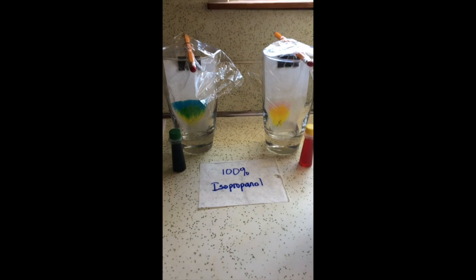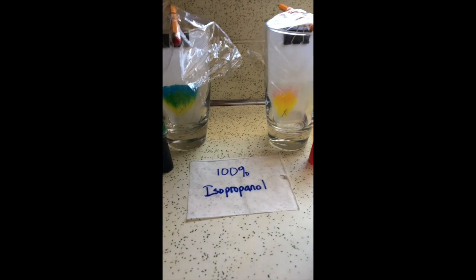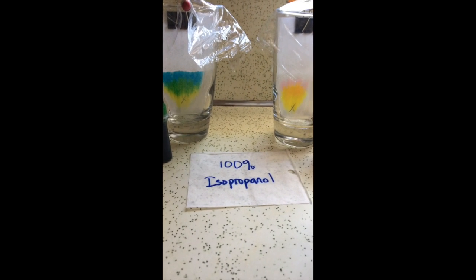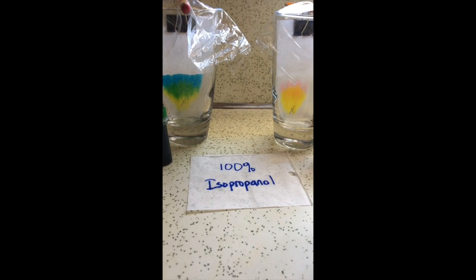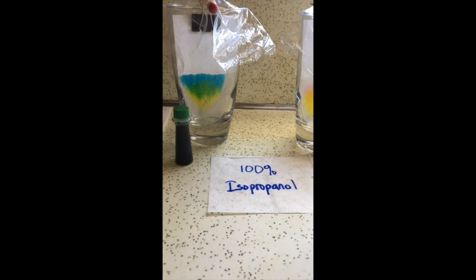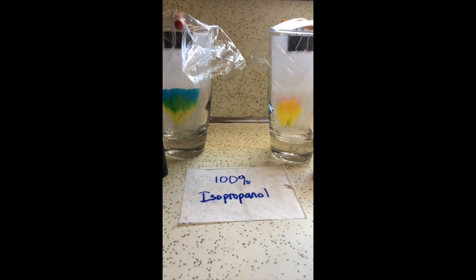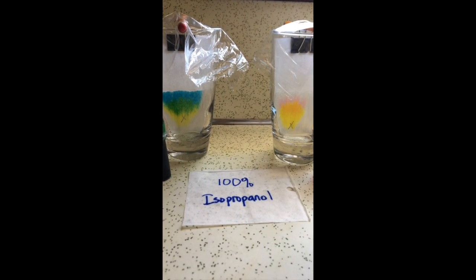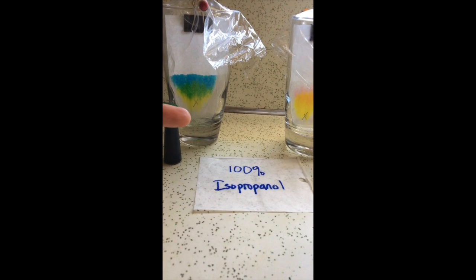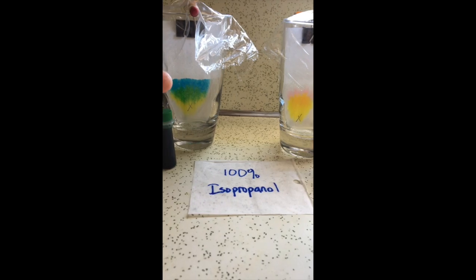So taking a look at the action on the 100% isopropanol, that's in the bottom there. And again, it's just touching the piece of, it's actually coffee filter paper. And I put drops, we have green food dye on the left, and then we have yellow food dye on the right. And then you put those in just so the very bottom of the papers touch the isopropanol, and then the solvent climbs up the paper by way of capillary action, and it will separate the different components based on polarity.